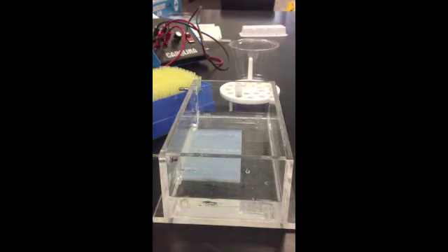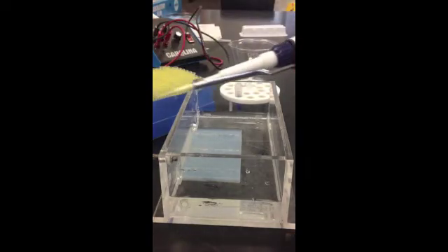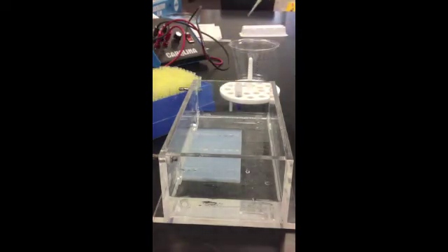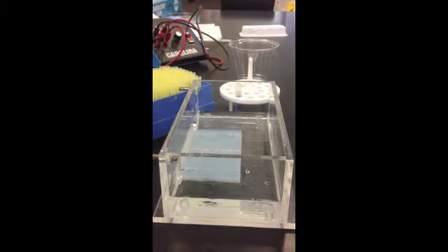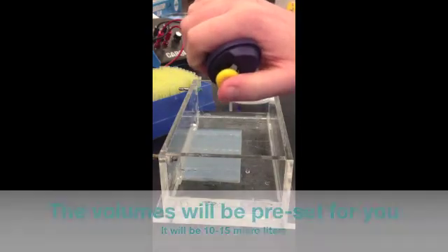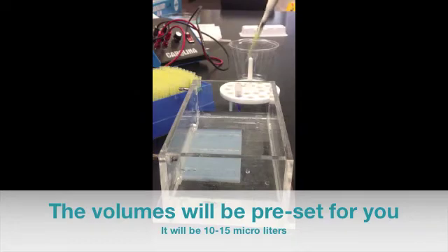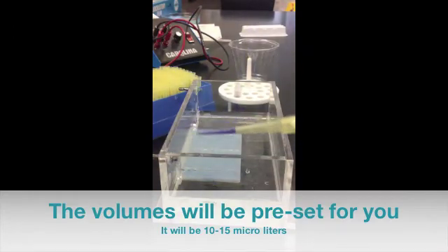So whenever you're loading DNA samples, even though this is just pretend, when you're using real DNA, you need to use a different tip every time. So I'm going to get this tip out of here, put into garbage, and get a new tip on here. I'm going to push down on my plunger until I feel that resistance. Then I could insert the tip into our DNA sample and release the plunger. Now the DNA is all in that tip. You can see it there.